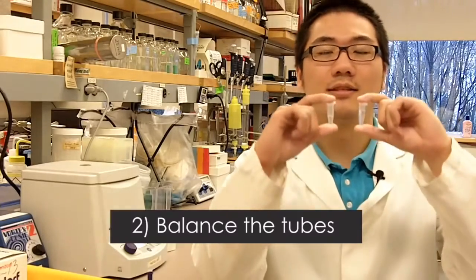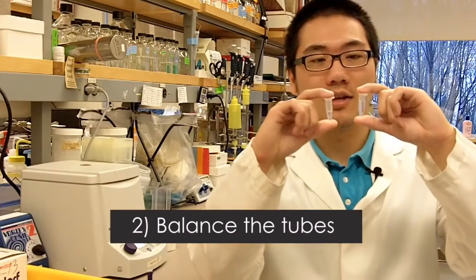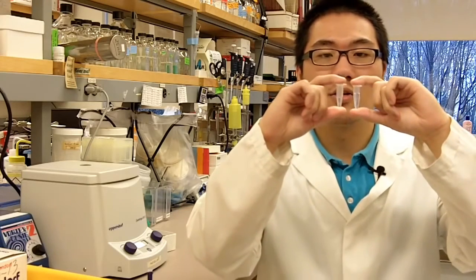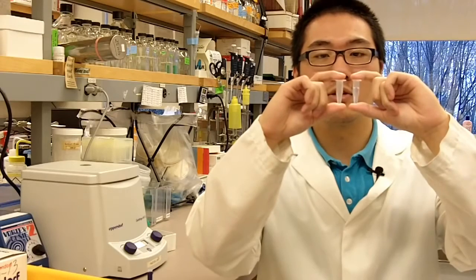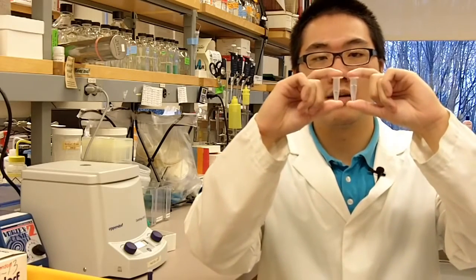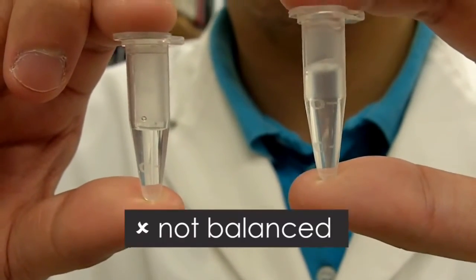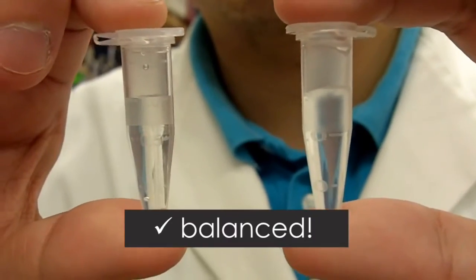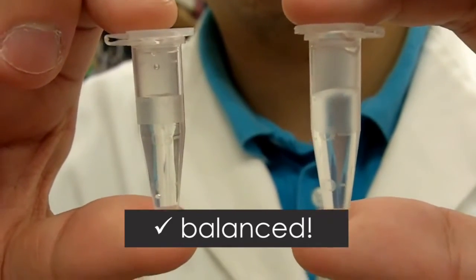The second thing you need to watch out for is you have to balance your tubes. So here, since the volumes you can put in the tube are small, you don't have to weigh them. All you have to do is make sure the solution in the two tubes is at the same level. As you can see now, the tubes are not balanced. One of them is at approximately 1 mL, the other one is at 0.5 mL. So in order to balance the 1 mL tube, you should have another tube which also has 1 mL of solution in it, like that.